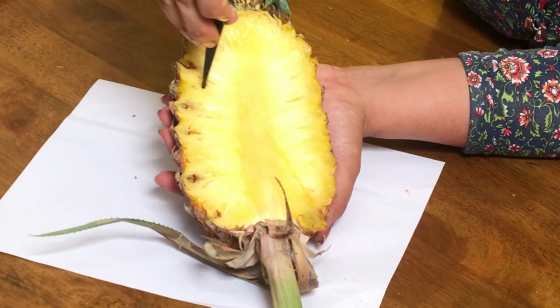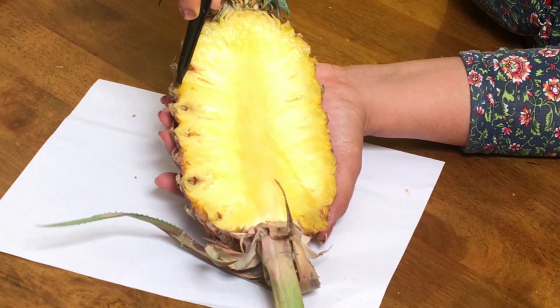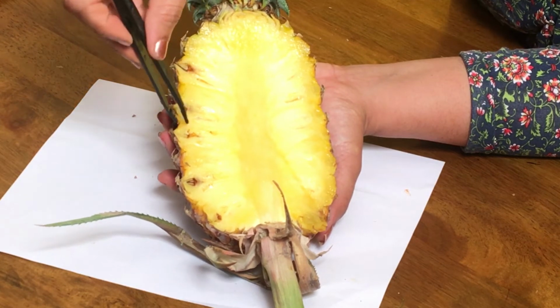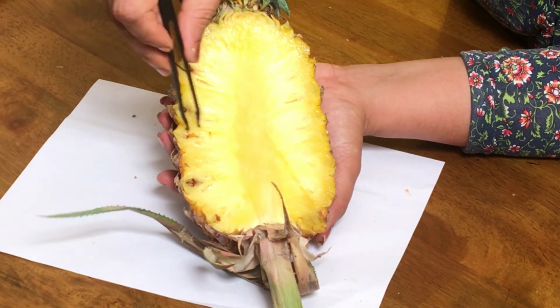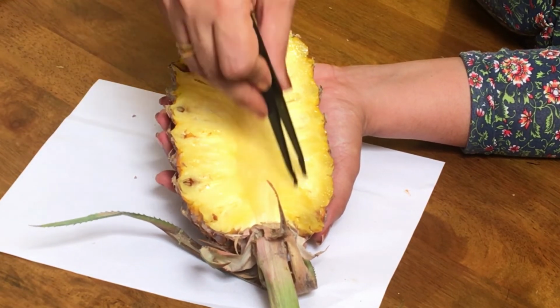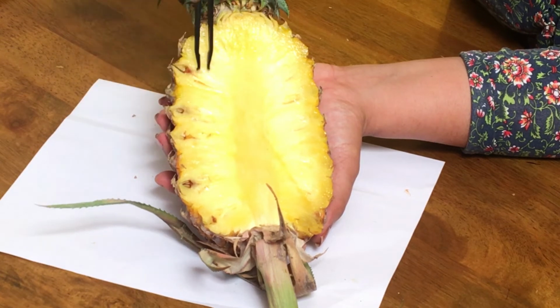So this is one flower. See, you can see here, this is one flower. This is another flower. So these are all flowers, but right now they have all matured. The pistils have matured into fruit, and all these fruits got combined together and look like a single fruit. Now what is this edible fleshy part of pineapple?